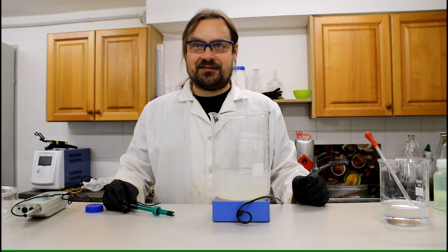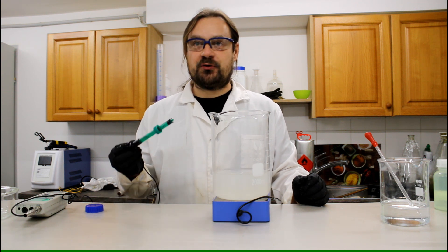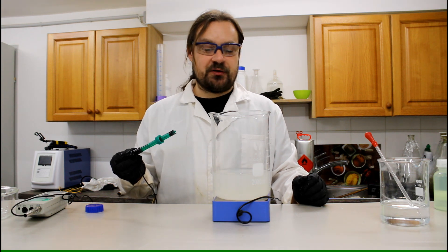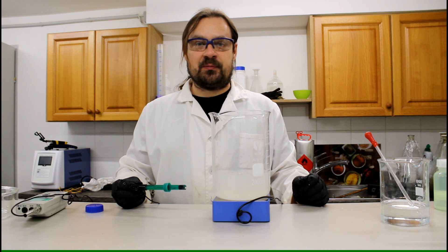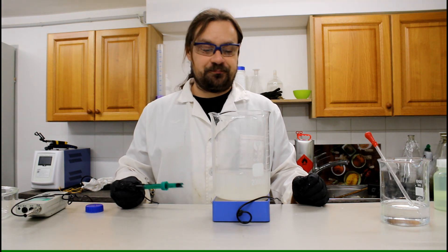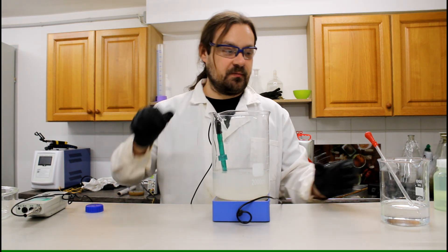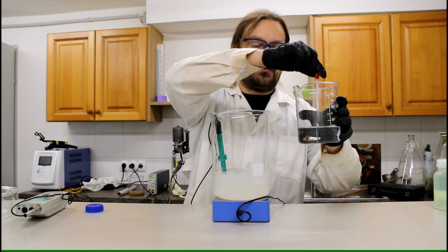Okay so the silver nitrate has finally dissolved. So I am going to check the pH when I do the titration with the sodium hydroxide. The best results I am getting at about pH 11.5. So I am adding the pH probe. And now we are starting with the titration with the sodium hydroxide.